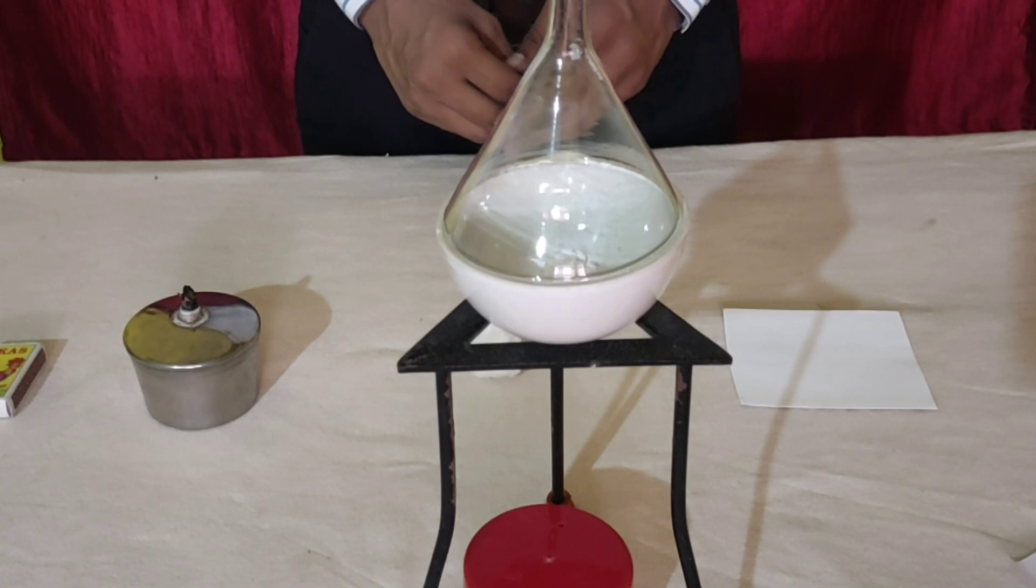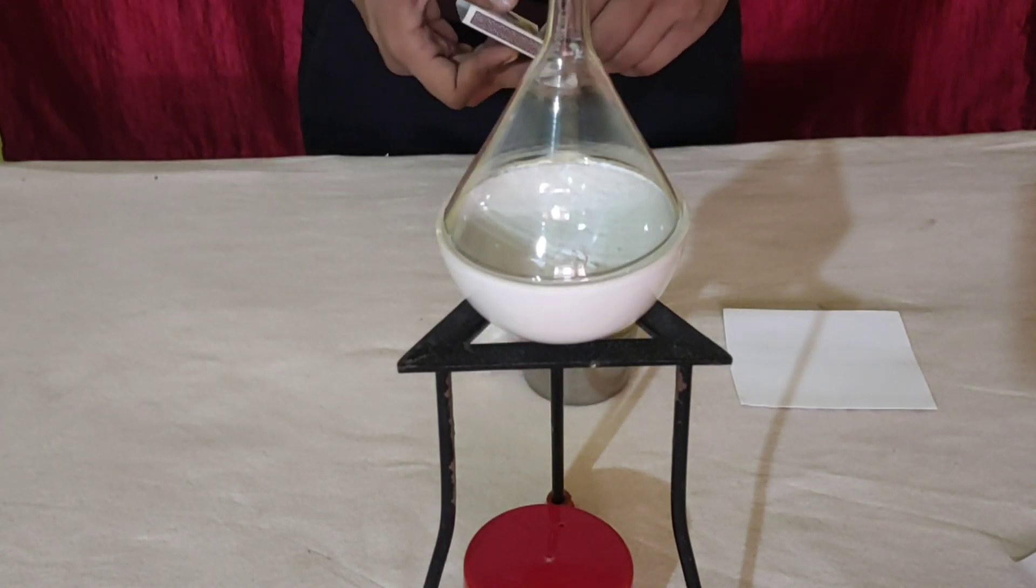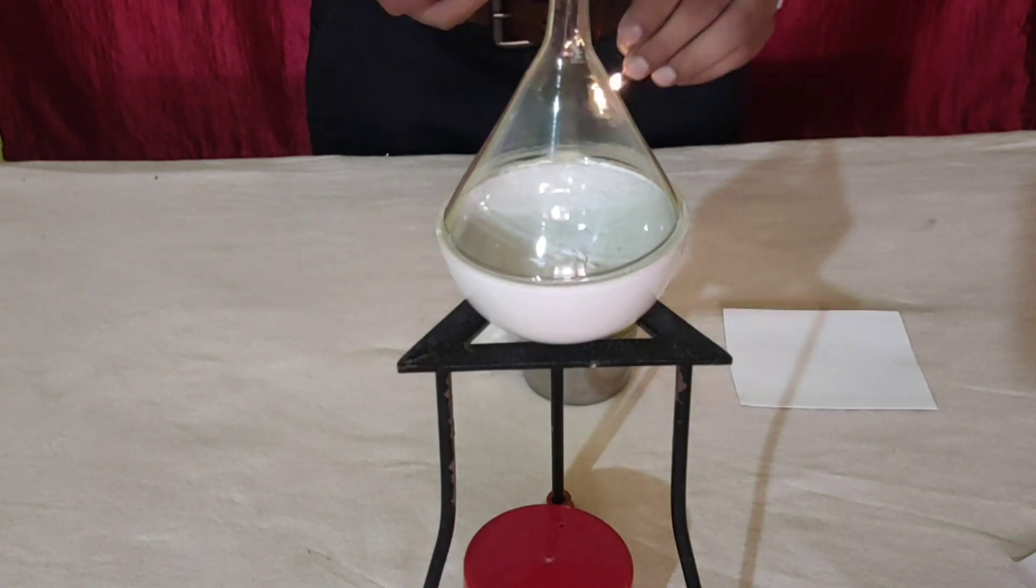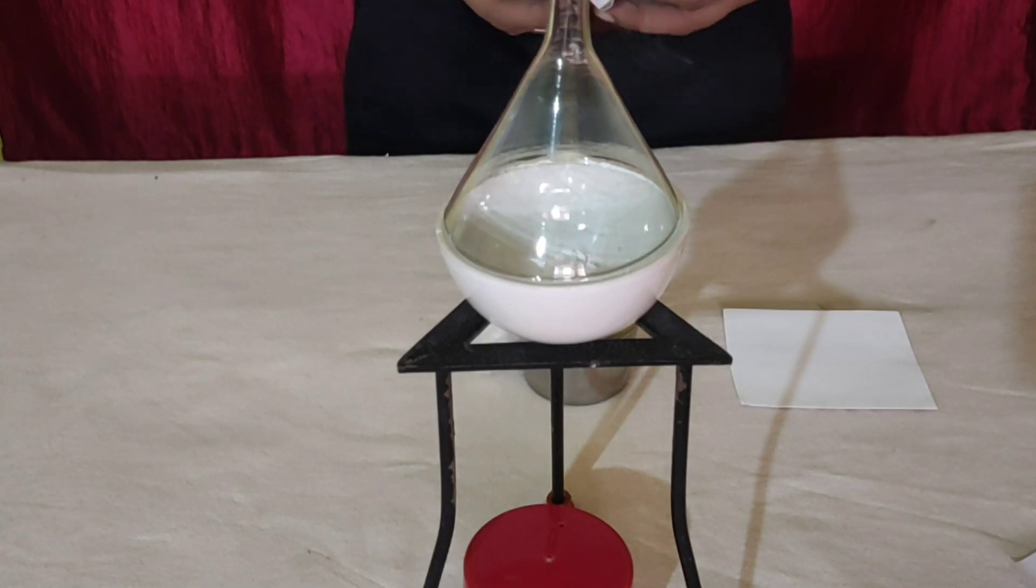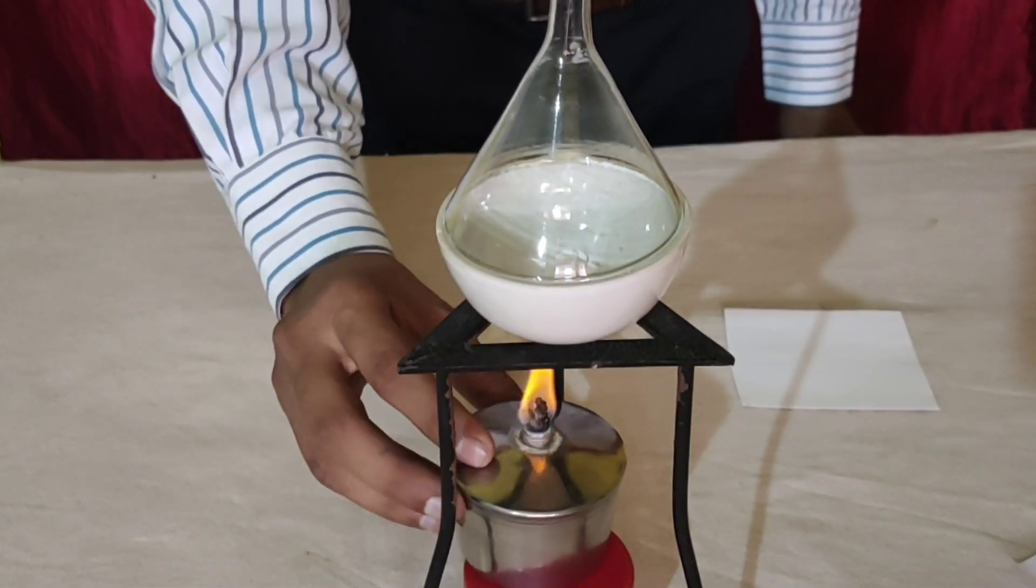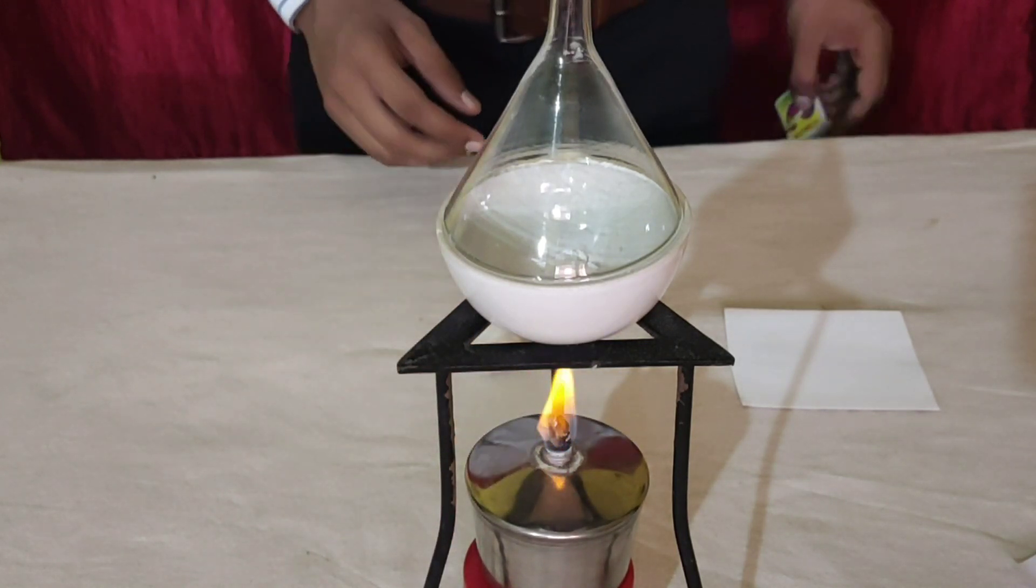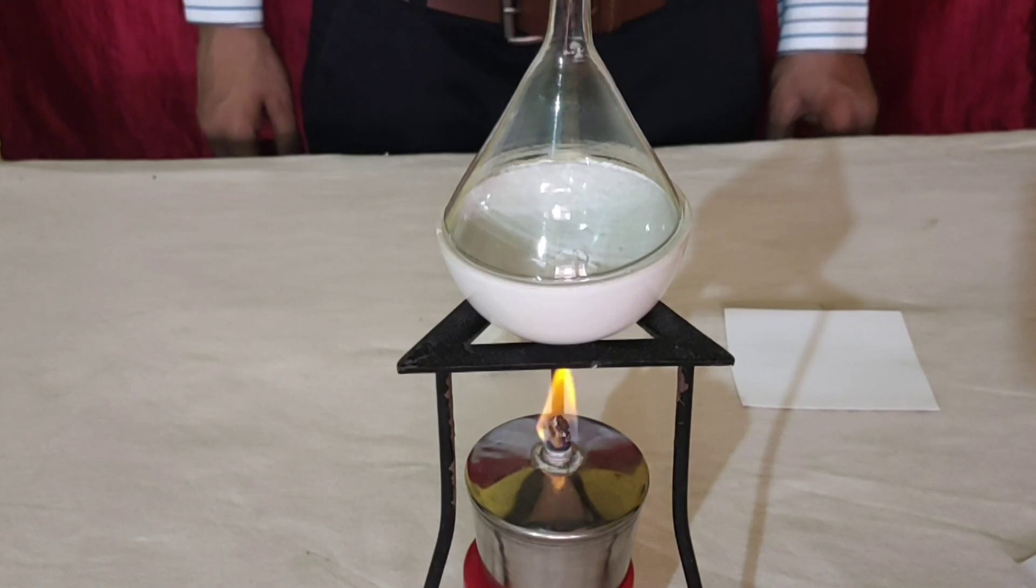Light the spirit lamp and place it under the tripod. Heat the china dish for few minutes and observe what happens.